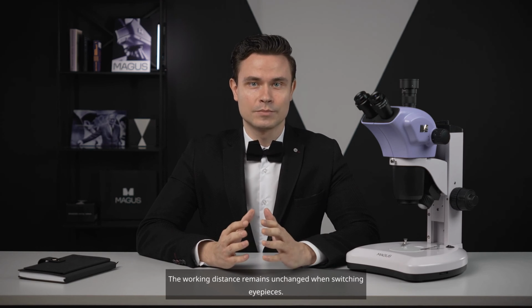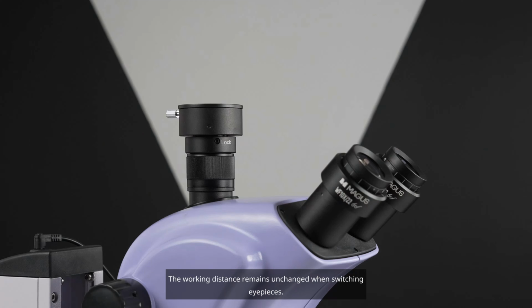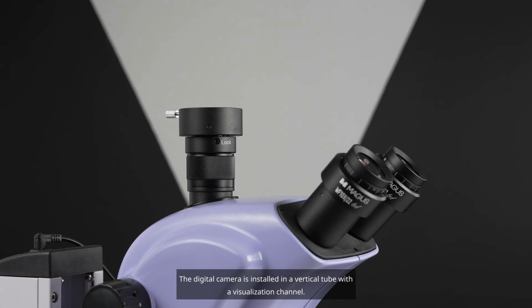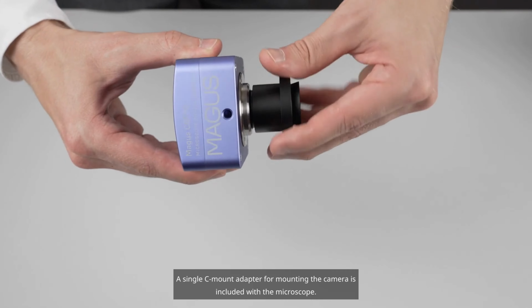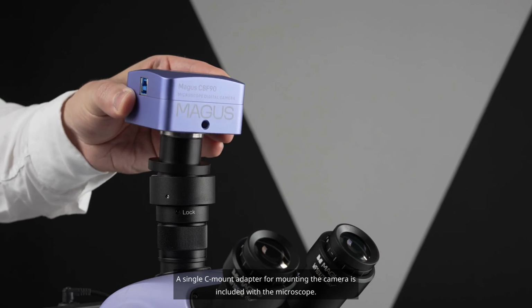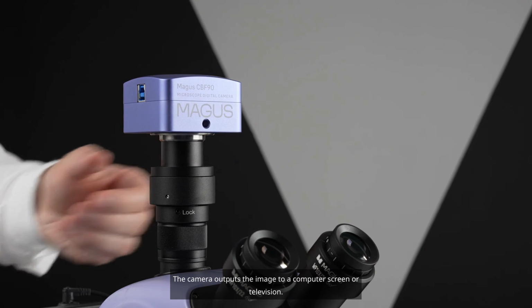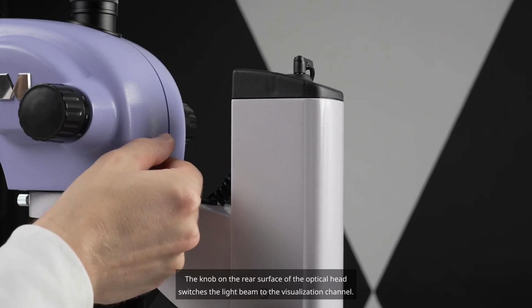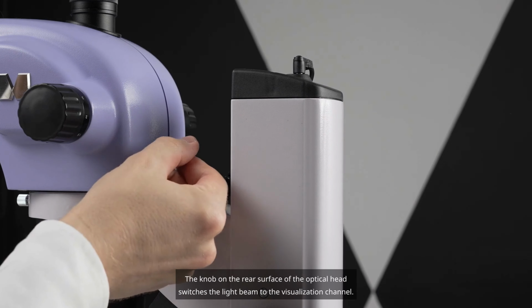The working distance remains unchanged when switching eyepieces. The digital camera is installed in a vertical tube with a visualization channel. A single C-mount adapter for mounting the camera is included with the microscope. The camera outputs the image to a computer screen or television. The knob on the rear surface of the optical head switches the light beam to the visualization channel.